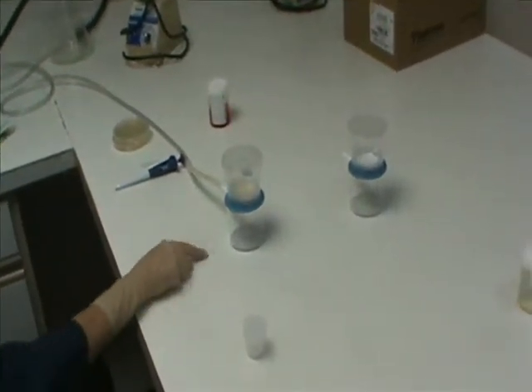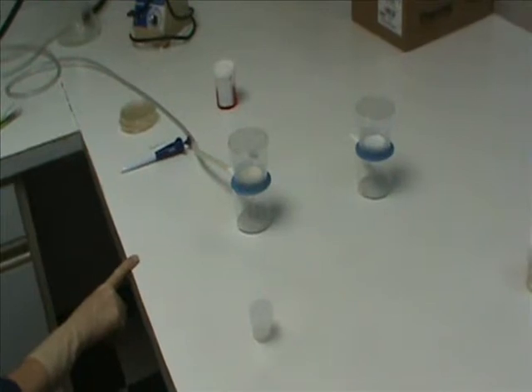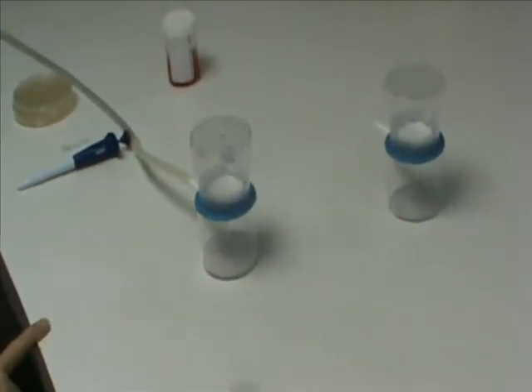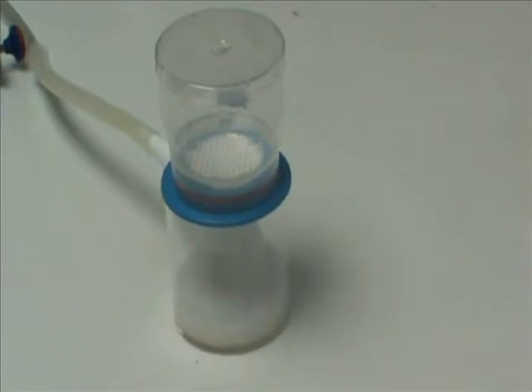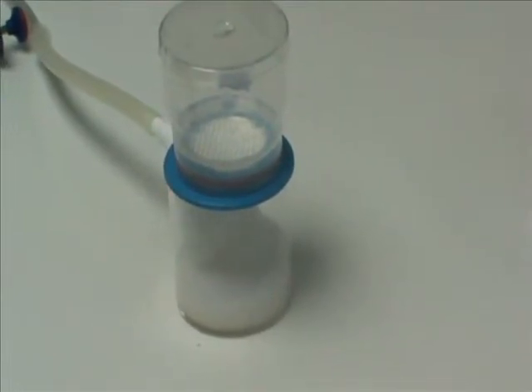The contents are then filtered and the filter is rinsed with additional fluid and this filter is plated onto agar media that will sustain the growth of clostridium.